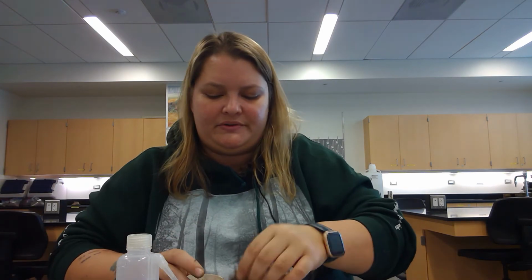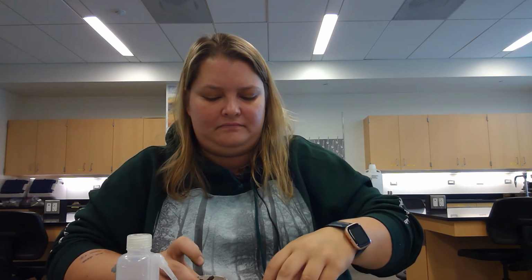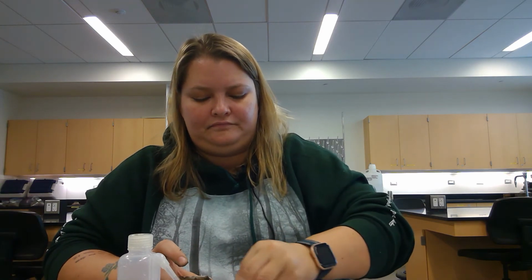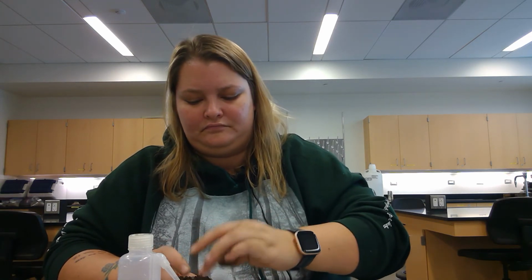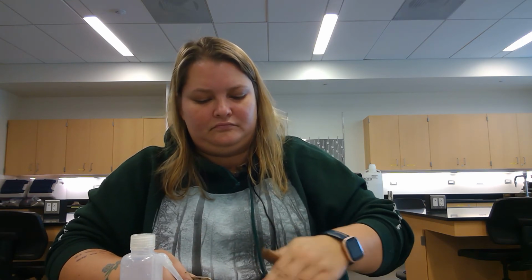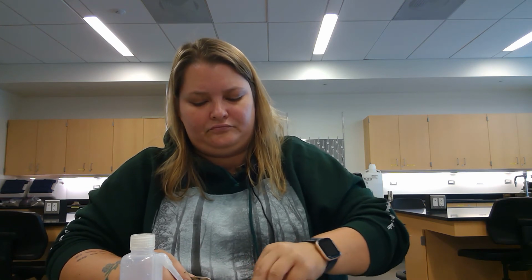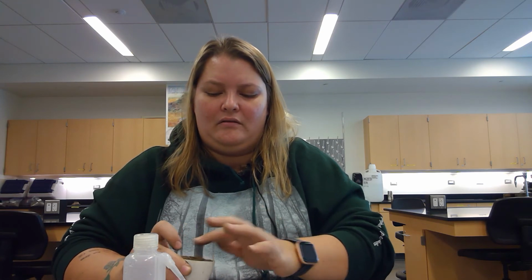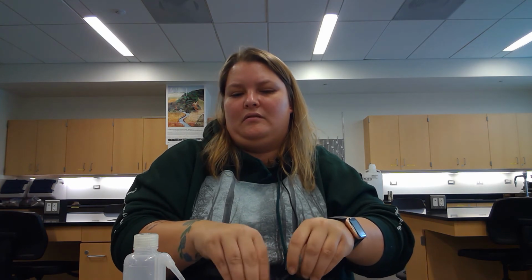So we're going to put it into our crucible. And this is 124.37.